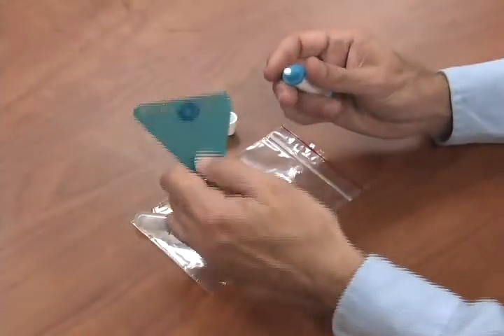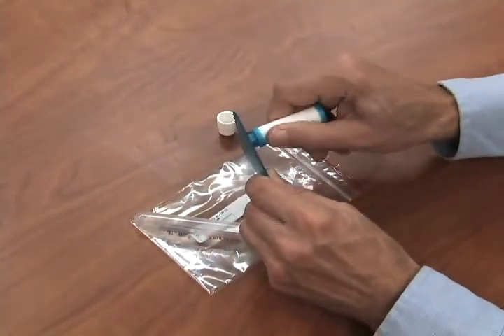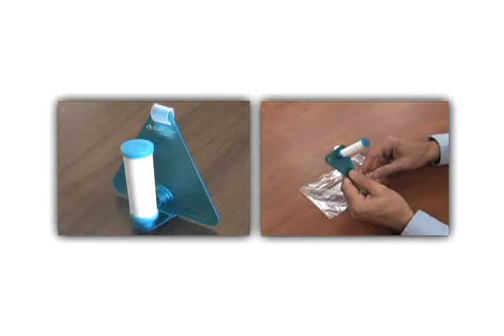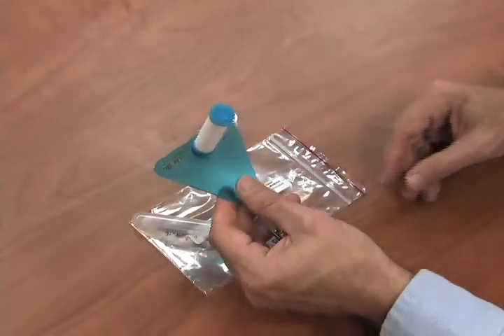Step 2. Keeping the diffusive body in a vertical position, screw it onto the supporting plate. If the vertical adapter was requested, install the adapter and then screw the diffusive body to the supporting plate. Install a collar clip on the supporting plate.